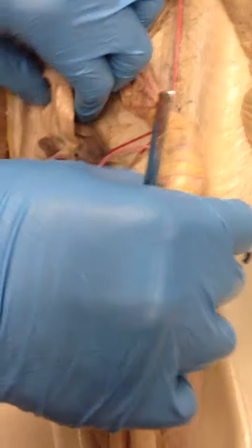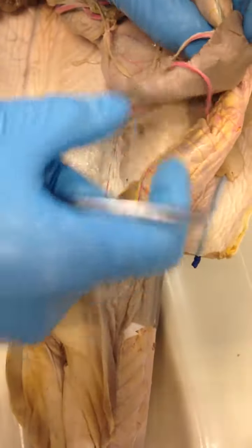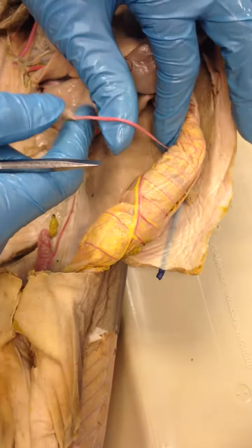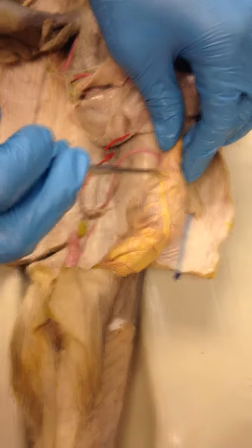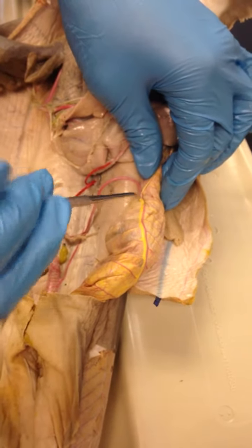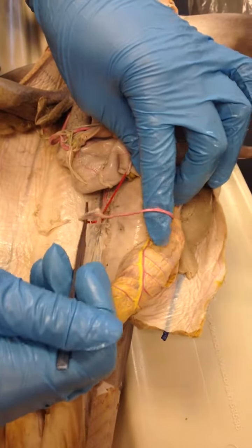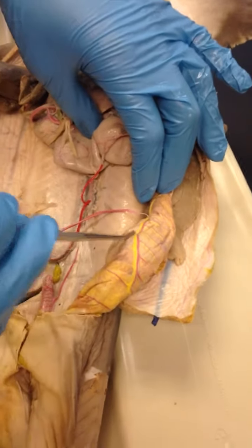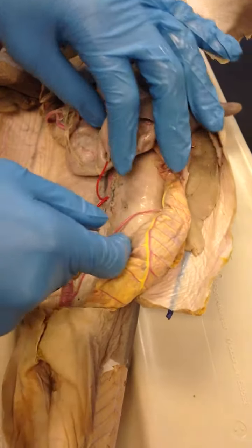So the anterior mesenteric artery will be located here. Sorry, they're all tangled. Okay, so the anterior mesenteric artery is located here. It is actually part of the extension that comes off from the posterior intestinal artery, so it's here, right there. It's the second of the two, and it links to the intestine. So this is the anterior mesenteric artery.